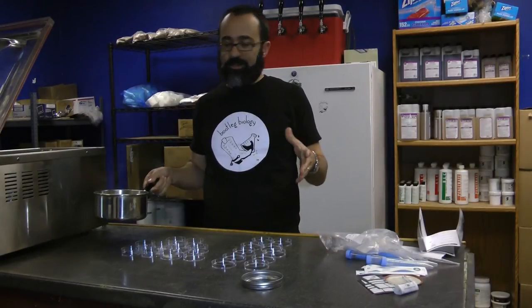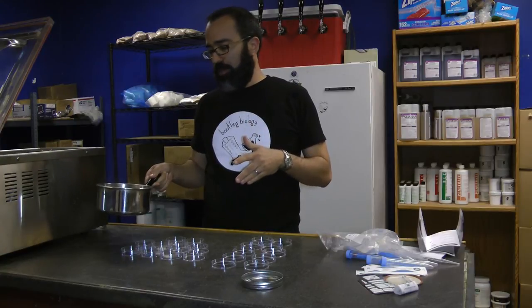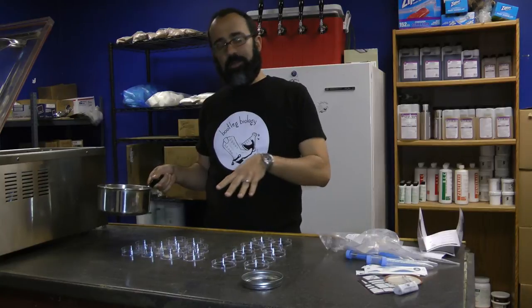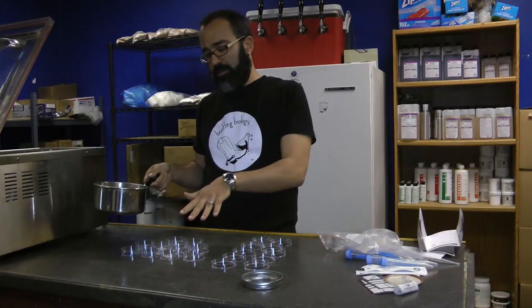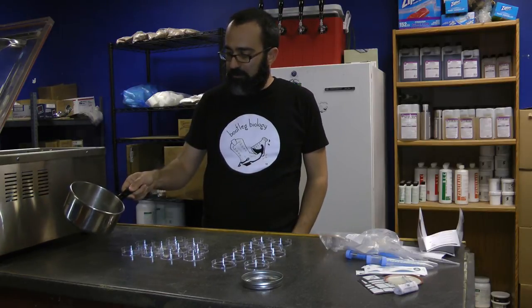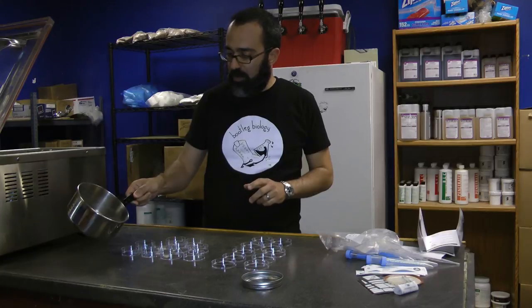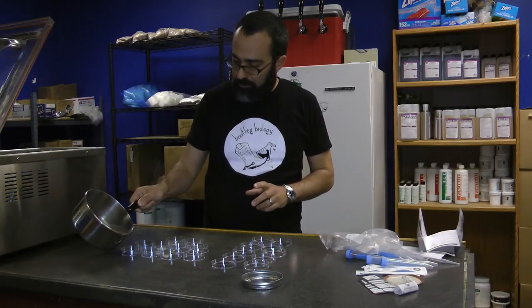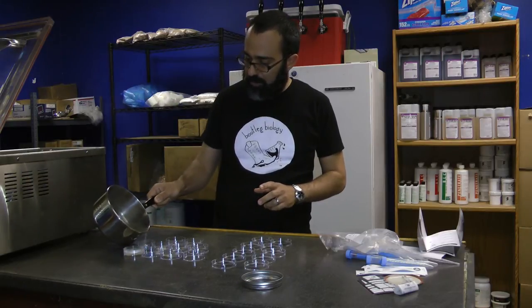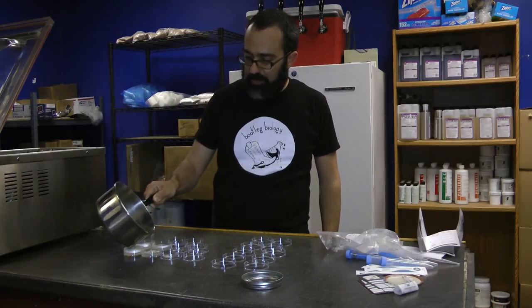So we're going to make agar plates. We've boiled the wild yeast agar mix with 200 milliliters of water, and that'll be enough to fill up the ten agar plates that you see here. Before it sets, you have to pour these, otherwise you'll have to re-boil it again. Just pour enough to cover the bottom. You might have some leftover — that's okay. Just pour everything evenly distributed across all the plates.